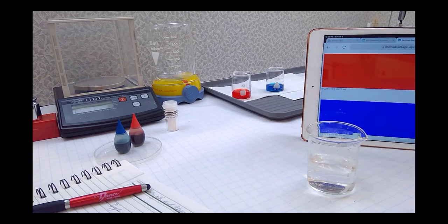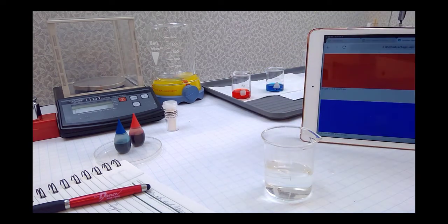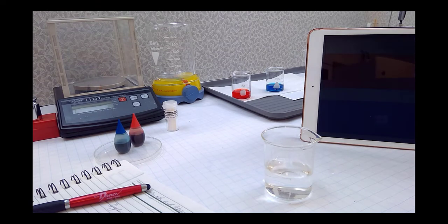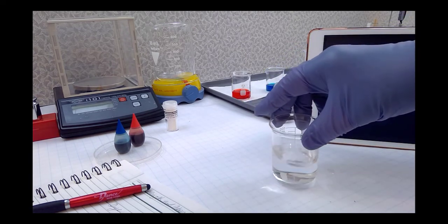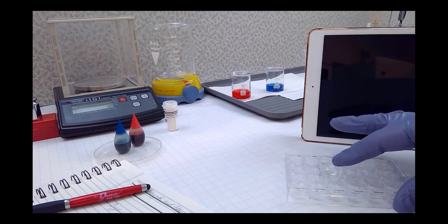We can go back and forth on this quite a bit, but what I'm interested in is the wavelengths that the phenolphthalein absorbs. In fact, that's the purpose of this experiment, to find out about the absorbance of light, and we'll use that to find out about concentration. So let me get my well plate out again, and I'm going to add some sodium hydroxide to my phenolphthalein solution. This is the solution here.